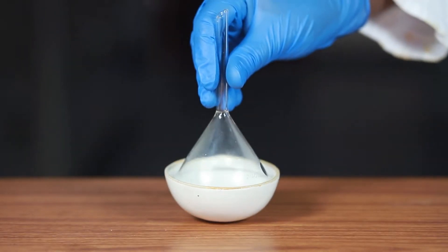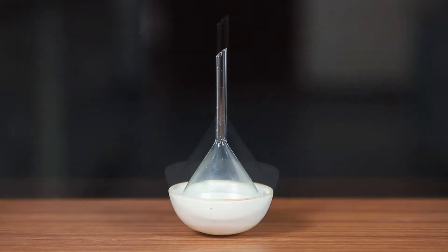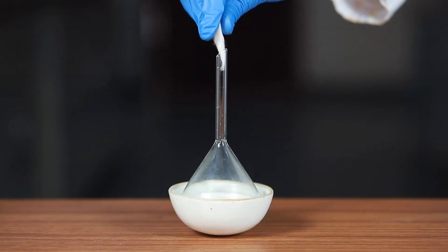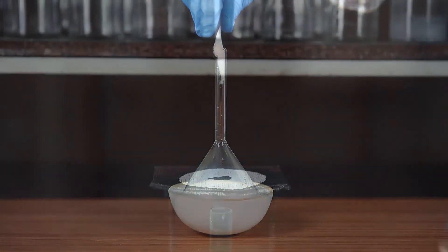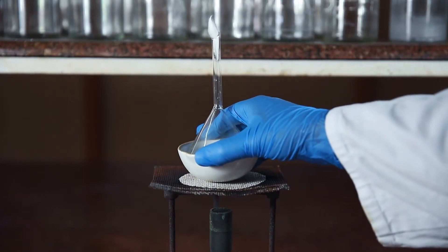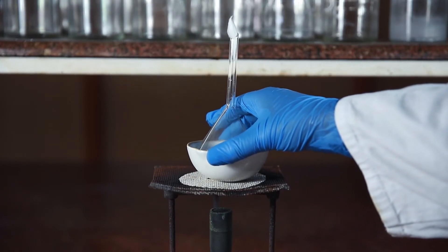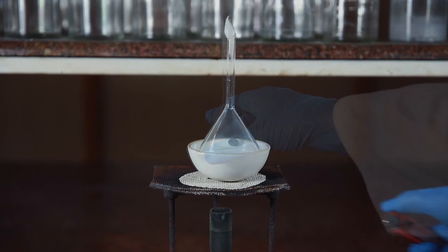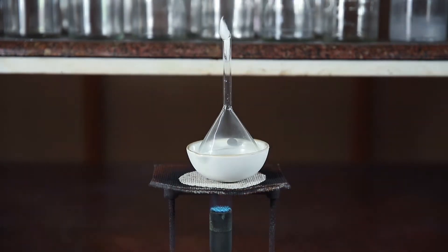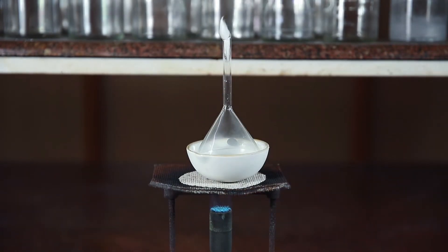Put an inverted funnel over the China dish and insert a cotton plug on the stem of the funnel. Place the China dish over the wire gauze on the tripod stand, then turn on the burner and heat the China dish slowly.